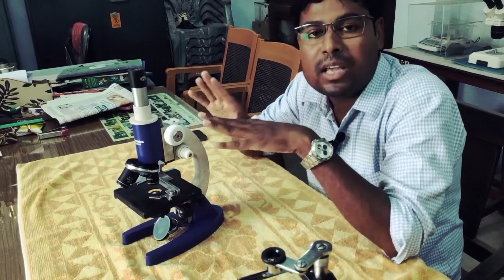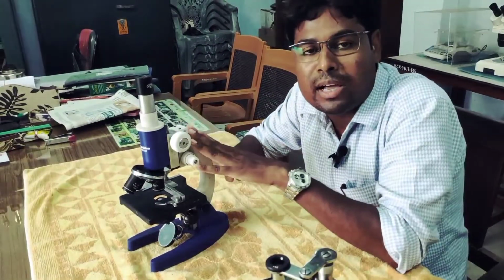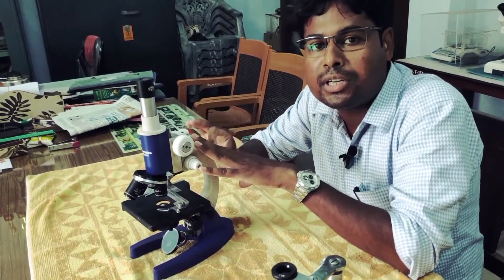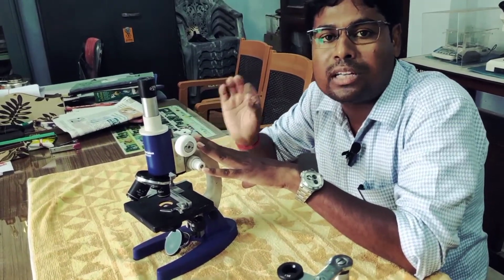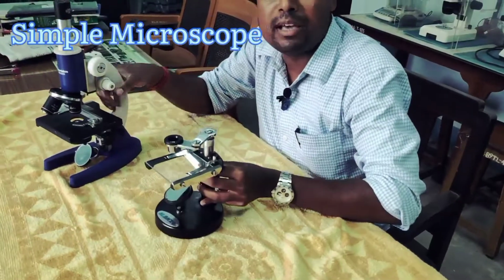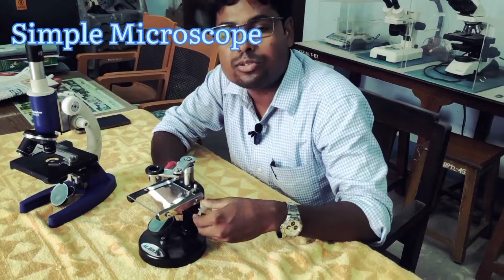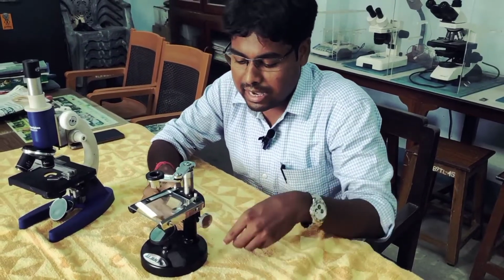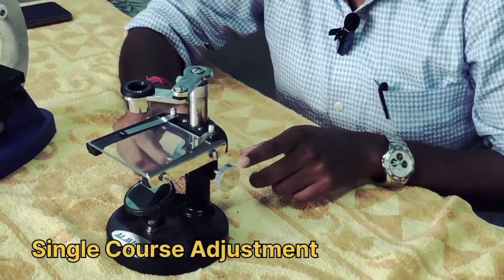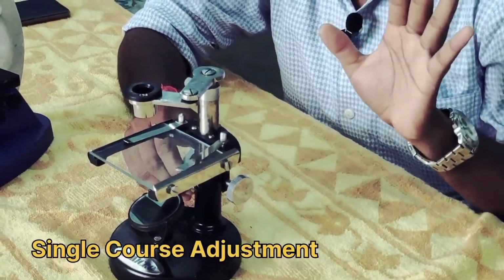So this is the compound microscope, and you can use it for minute vision of your target tissue or microorganisms. Next one is the simple microscope. Here is a single screw. This is the coarse adjustment screw only, there is no fine adjustment screw.